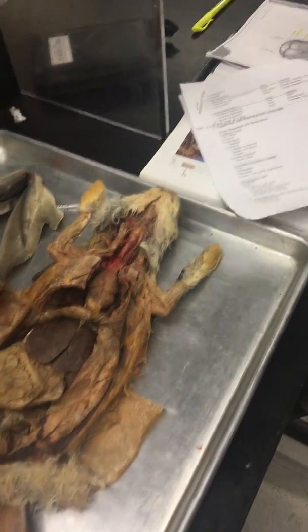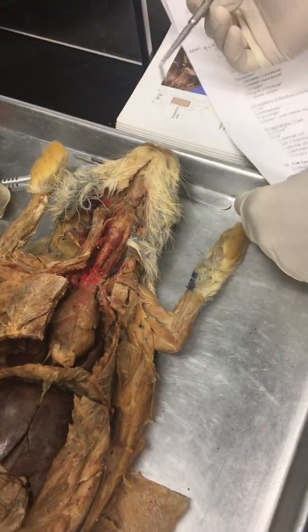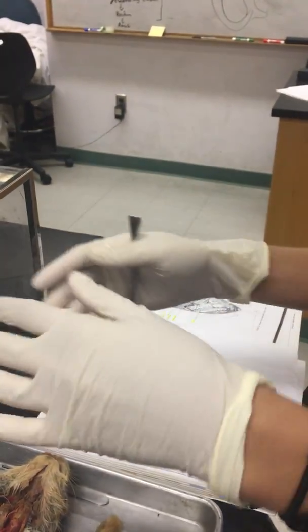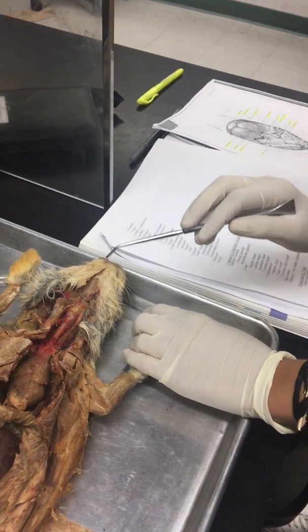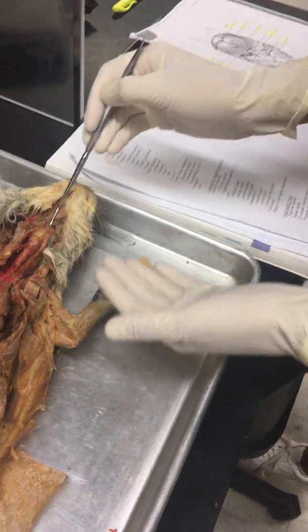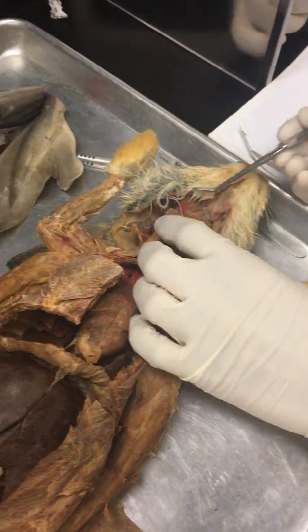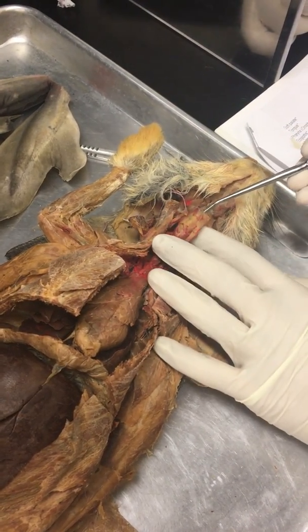So, I mean, the oral cavity is just the mouth area. And it looks like in the book of the cat, the hard palate is anterior to the soft palate, but it's just on the roof of the mouth, then the tongue. And then the pharynx, we also can't really visualize, but it'll be in this general region, I'd assume. Then the epiglottis is the cartilage that covers up the trachea to prevent food from getting in it.